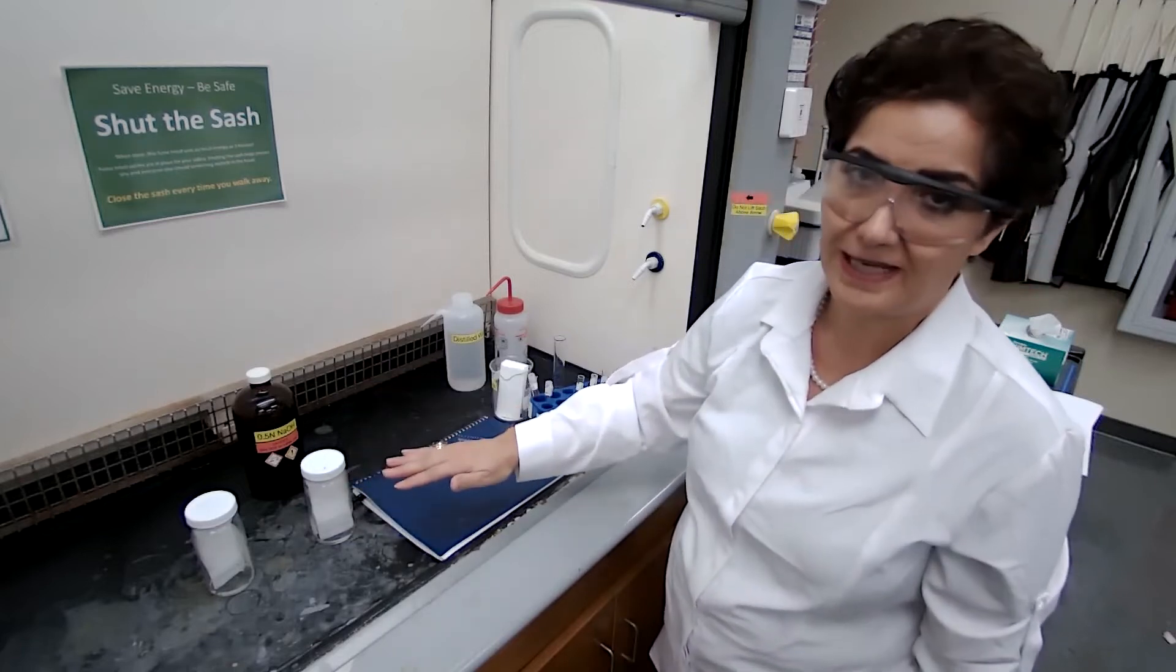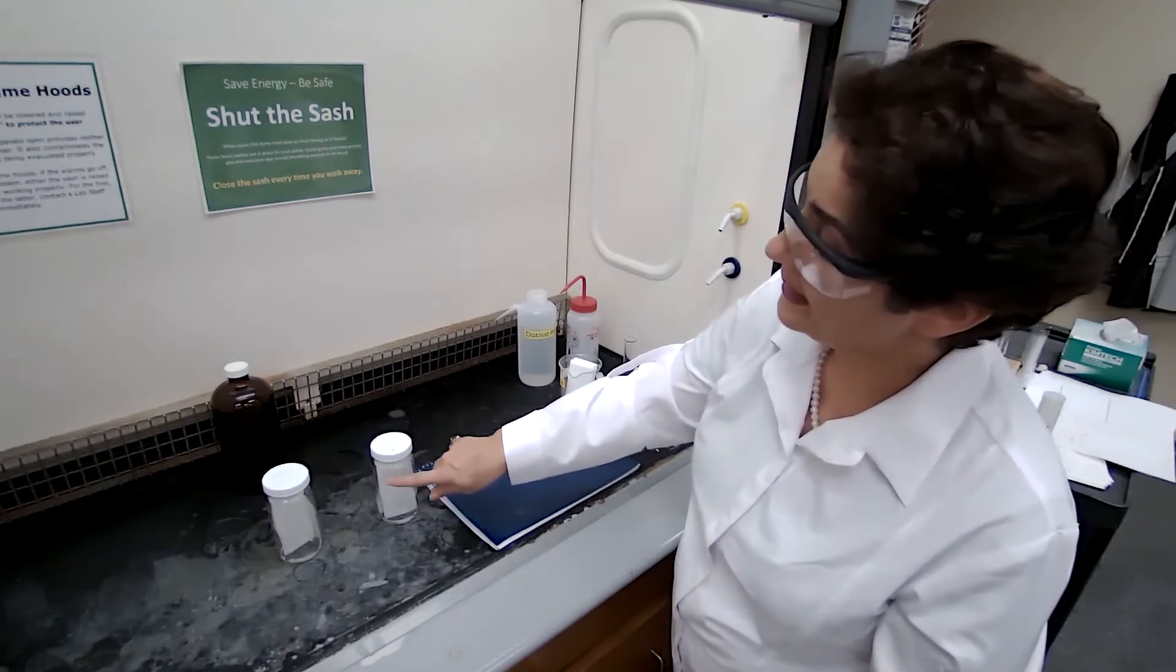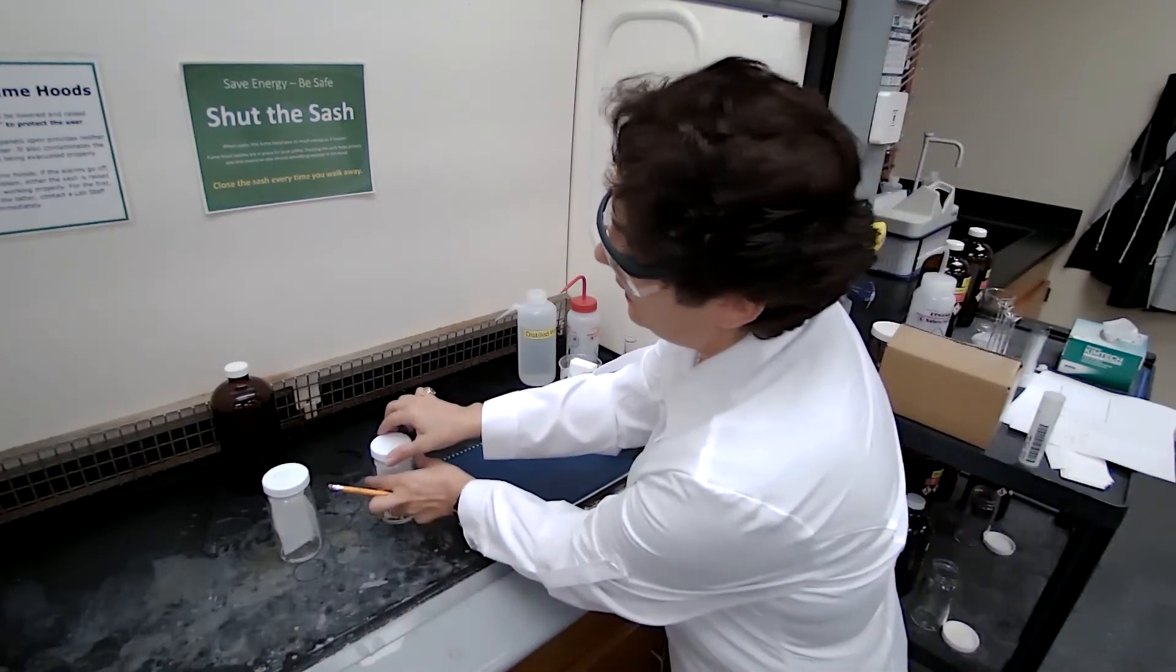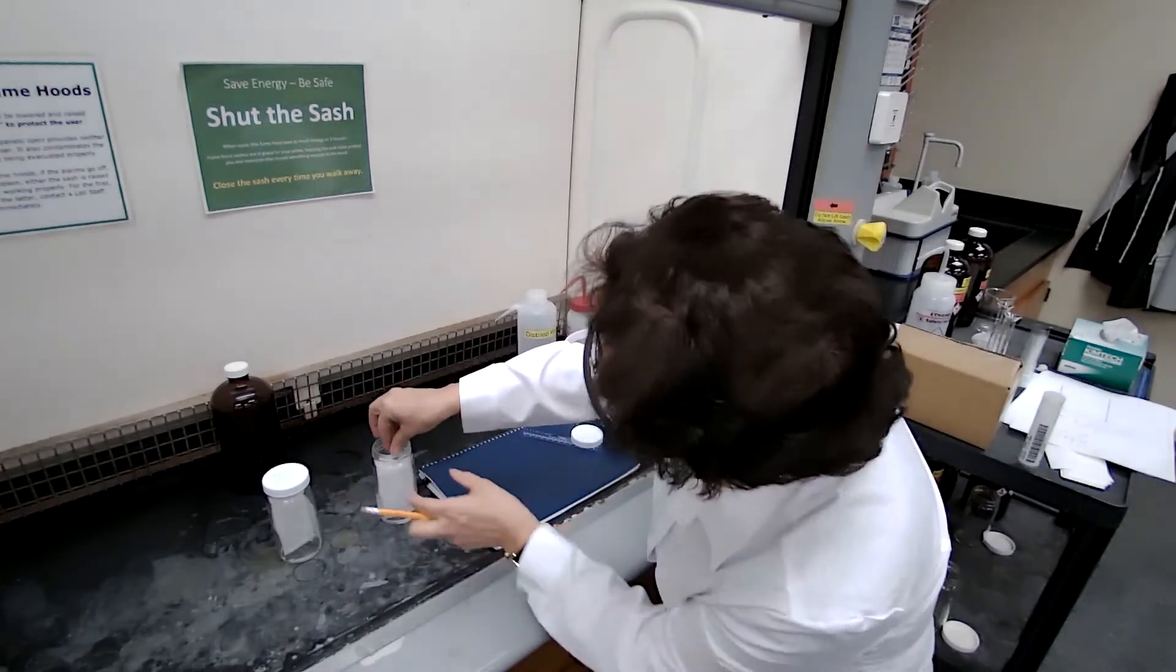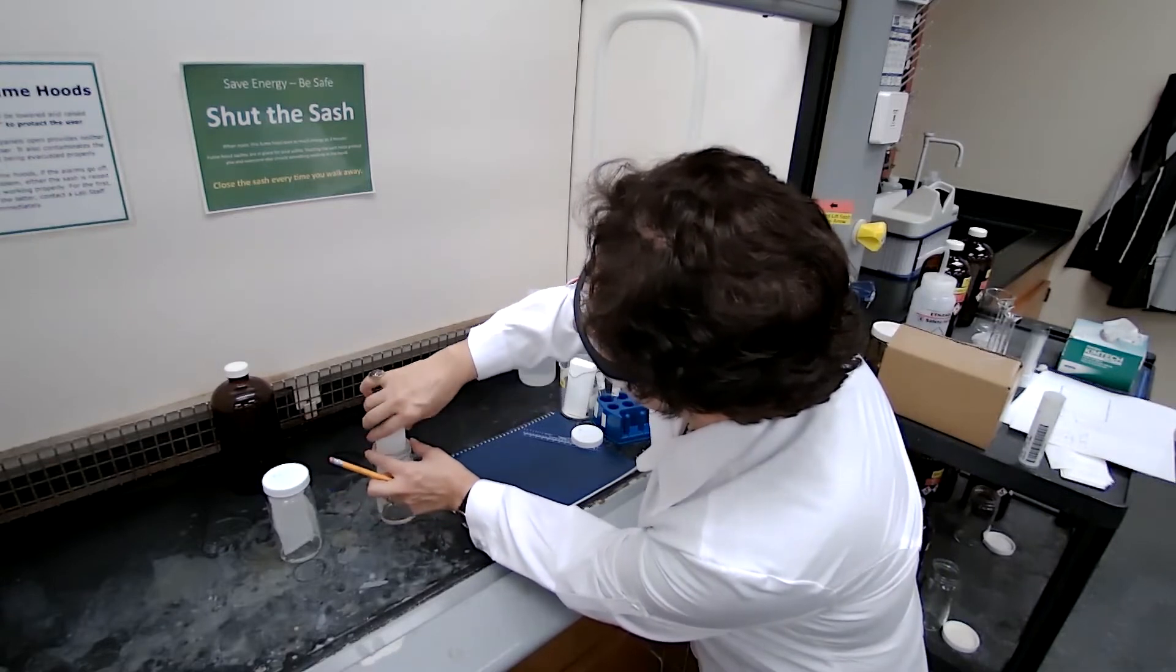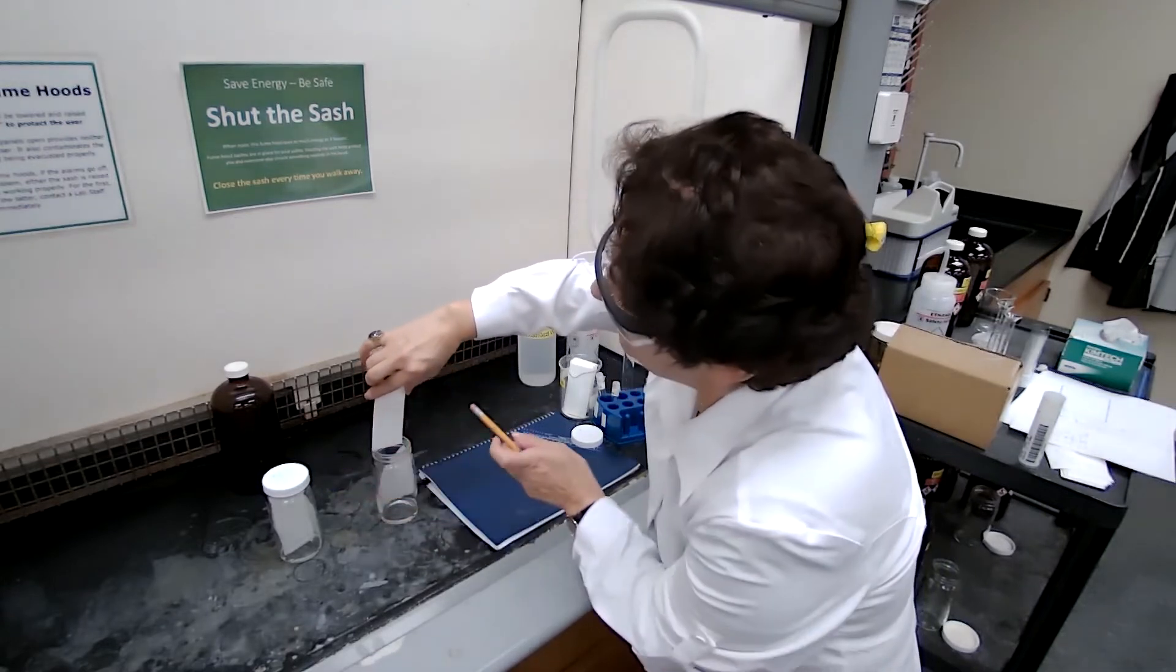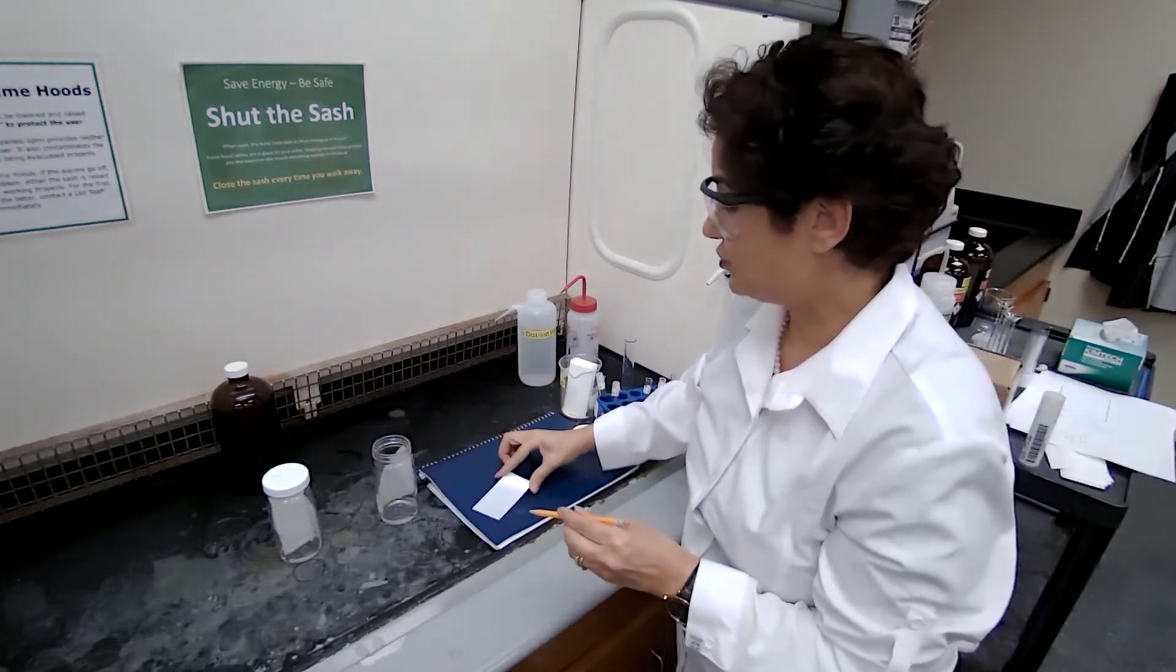So now the mobile phase has gone up and we are ready to stop the developing. And as soon as we take it out, we have to mark the solvent front, which is the distance the solvent has traveled.